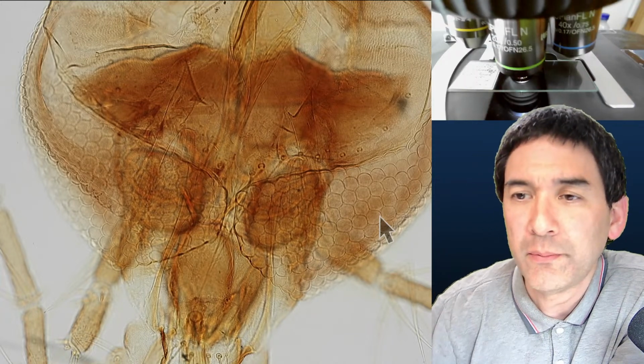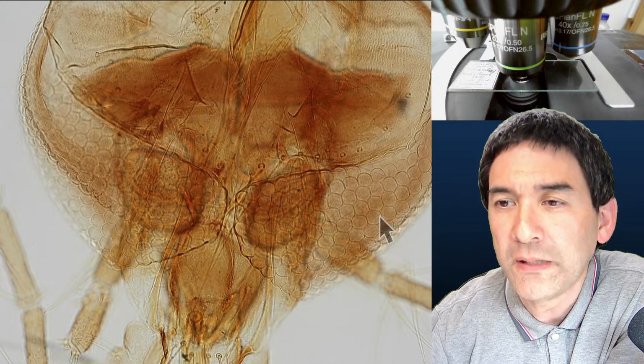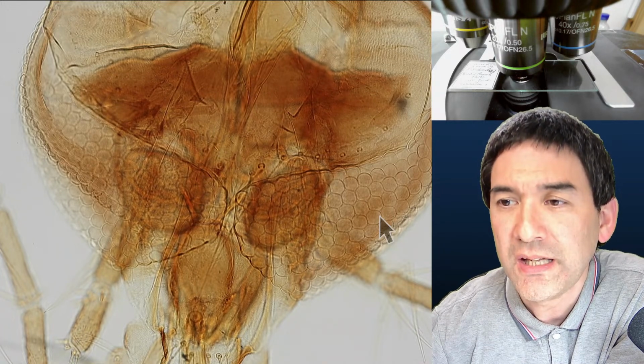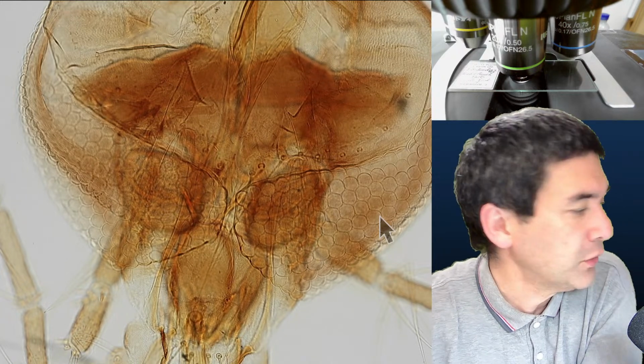Now Crispy B is asking, when looking for microscope lenses for photography, I often find the term Feldzahl in millimeters. Is that the same as the image circle? This is also referred to as the field of view.